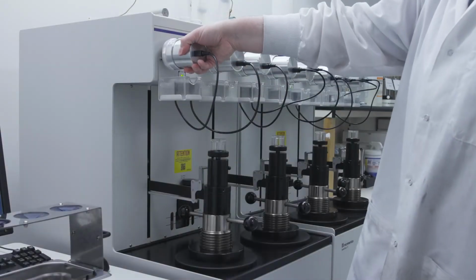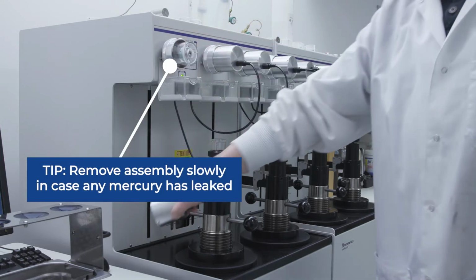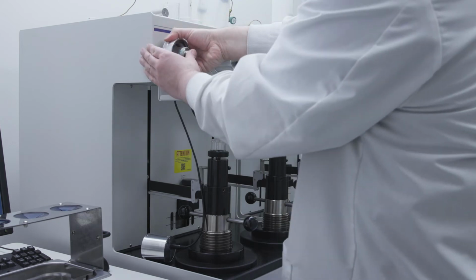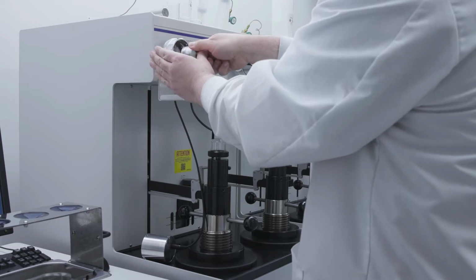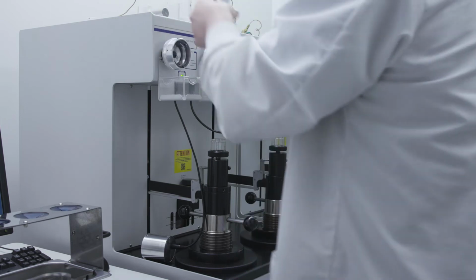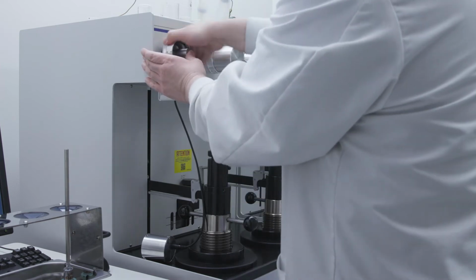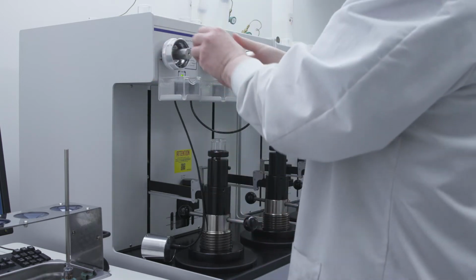Chris removes the capacitance detector assembly slowly in case mercury has leaked out of the penetrometer and into the detector assembly. The plastic trays below the low pressure ports are there to catch mercury in case a leak has occurred. He then loosens the low pressure port and removes the transparent retainer. Now Chris carefully slides the penetrometer from the low pressure port, being careful not to tip the penetrometer so that mercury doesn't pour from the end of the open stem. Since Chris is not starting another sample in the low pressure port right away, he will seal the port with a filler rod with a transparent retainer and a detector assembly in place.